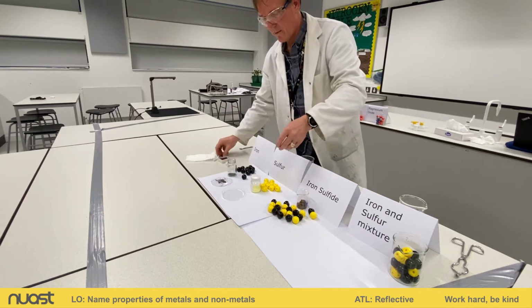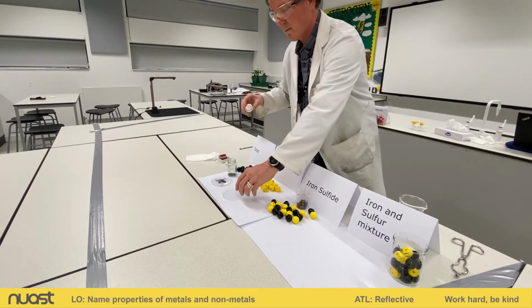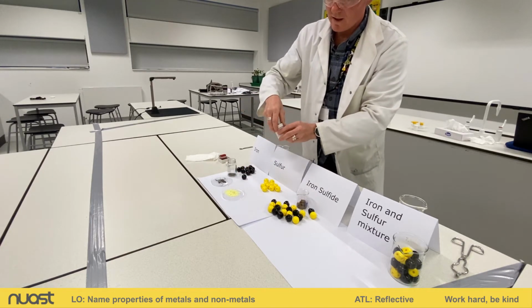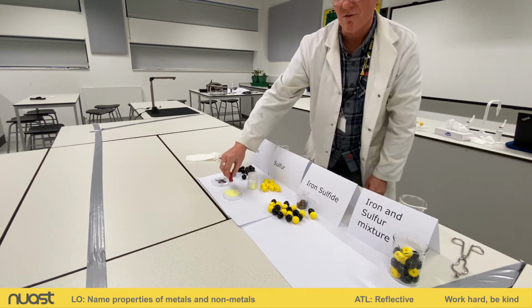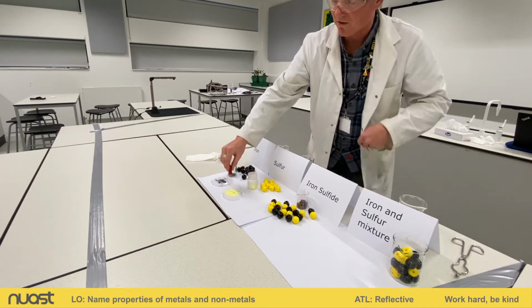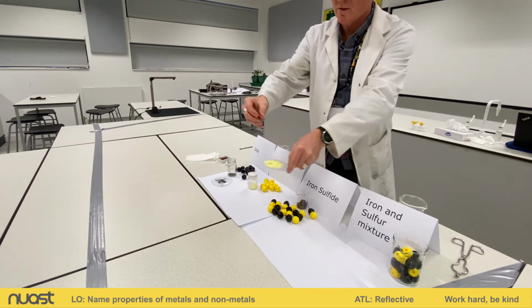All right, I'll do the same with our sulfur. So iron is magnetic. Let's see what happens with sulfur. Oopsie, some lumps in there. All right, now let's have a look. So I'll bring my magnet close to it. You notice I didn't wrap it in tissue. This is because I know it's not magnetic, and you can see the evidence for yourself. The sulfur is not attracted at all to the magnet.